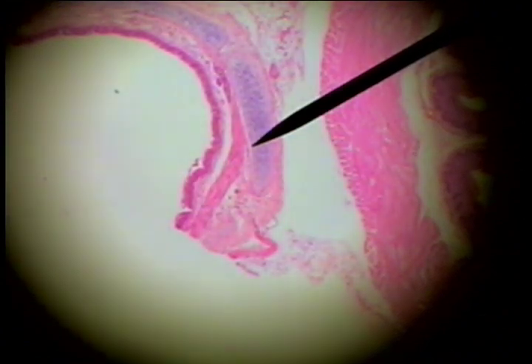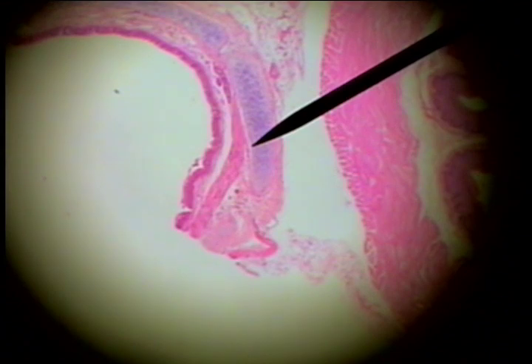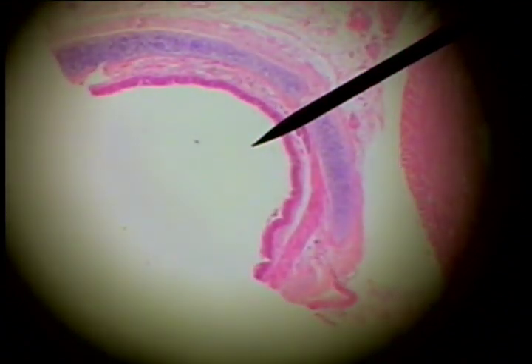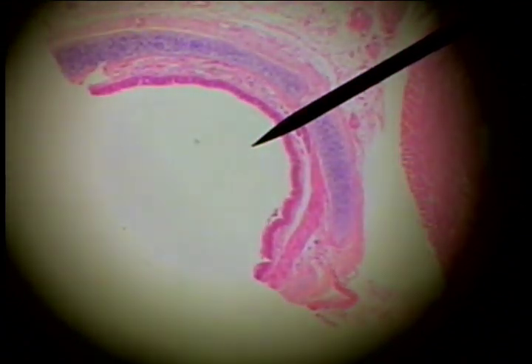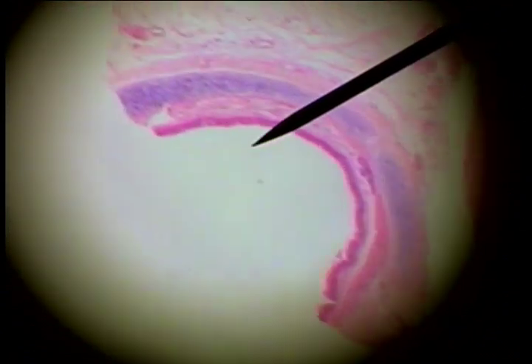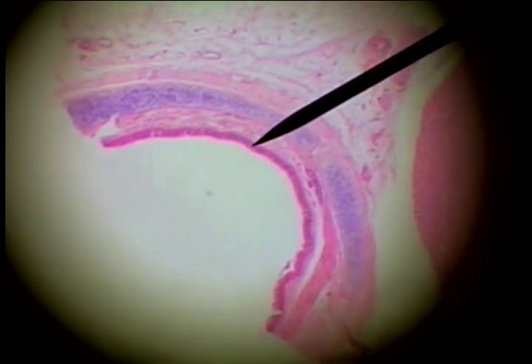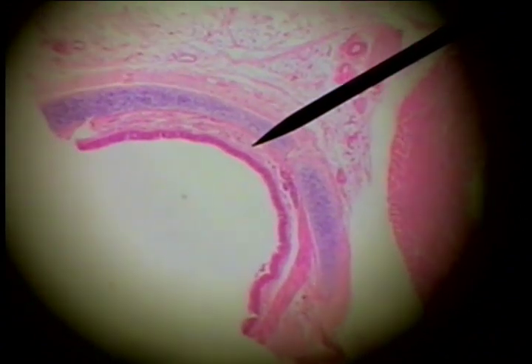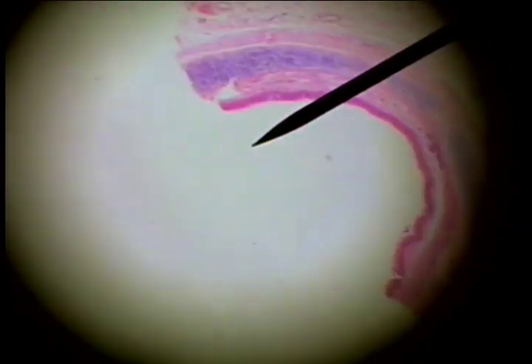Laboratory 8 deals with respiratory system tissues and organs. This is a C-shaped section of the trachea. This would be a complete circle of tissue in the trachea, but we have just a C-shaped portion here.